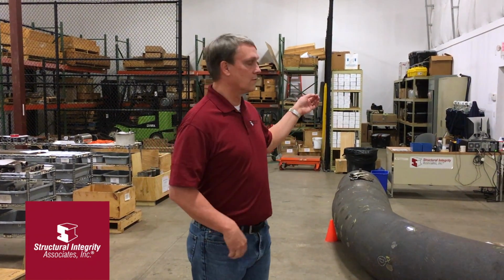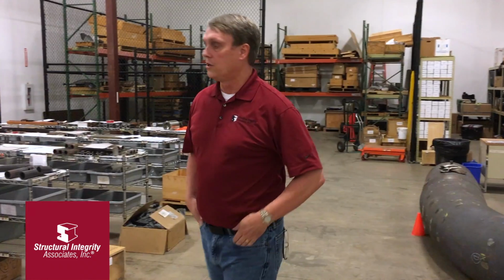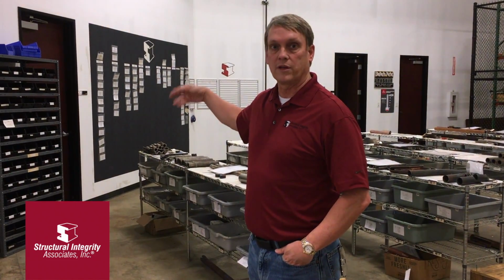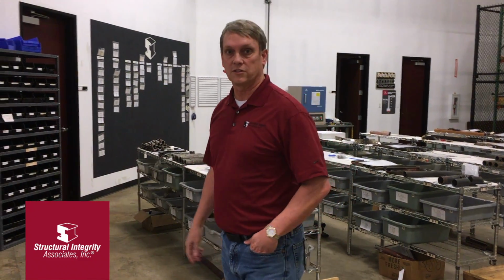Today I want to talk a little bit about the process that we go through when we're doing failure analysis of parts and components that our clients send in. The first thing that happens is samples arrive at shipping and receiving and get logged into our computer system, which we use to track projects from start to finish. In the shop we also have a tracking system on the board, so at any point in time we can very easily see where we are with regard to the overall investigation.